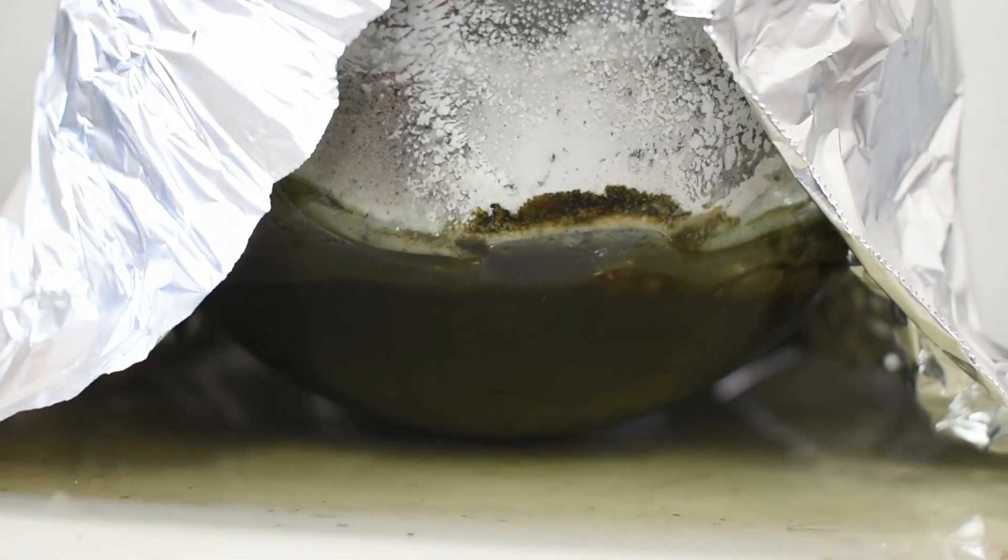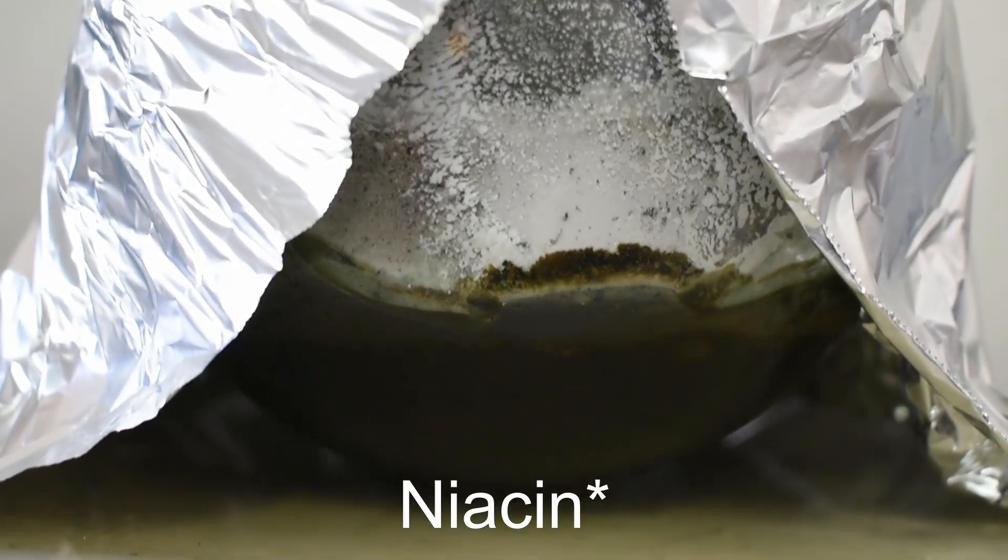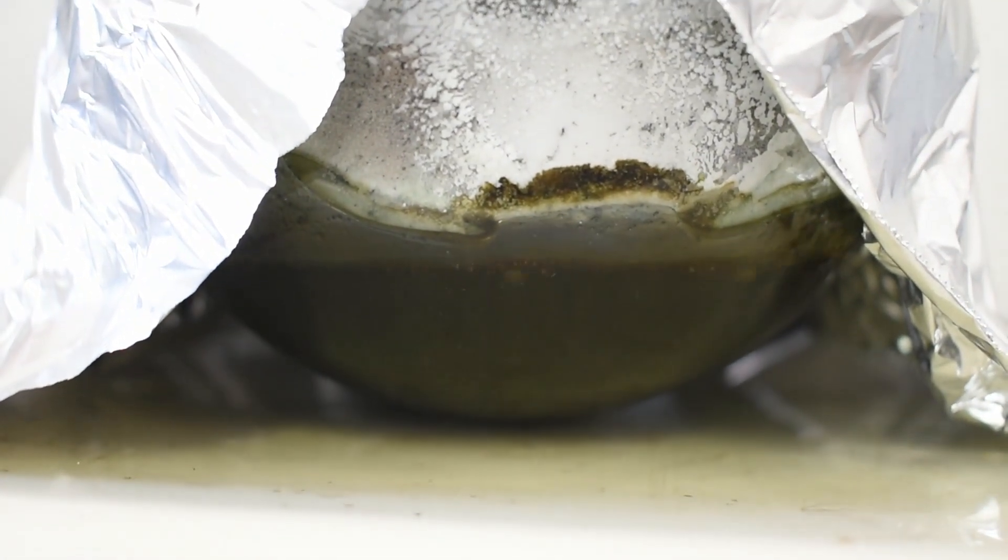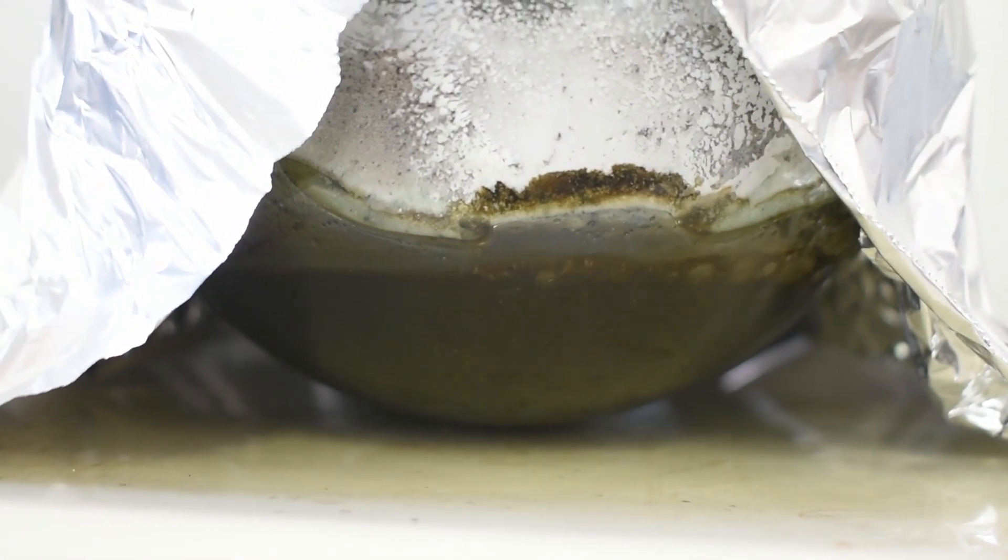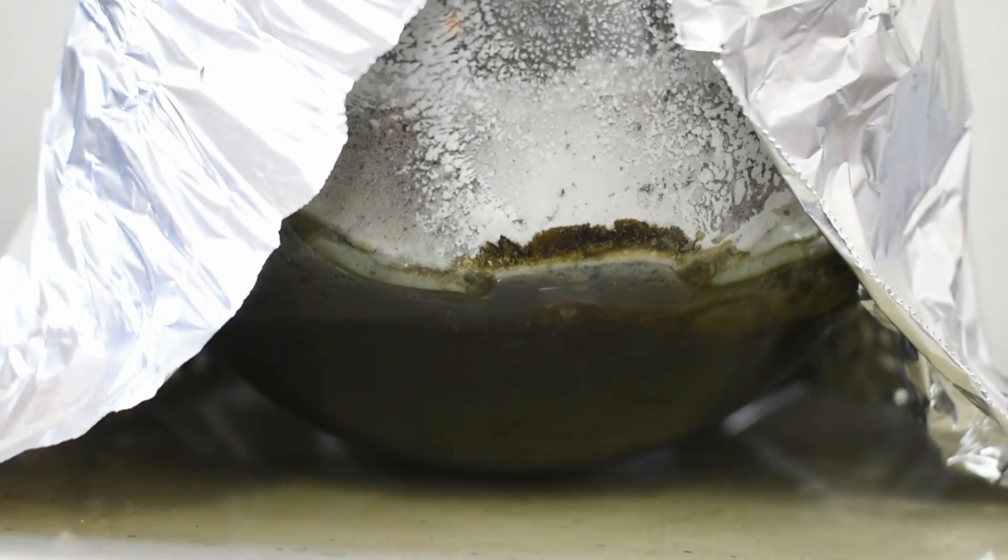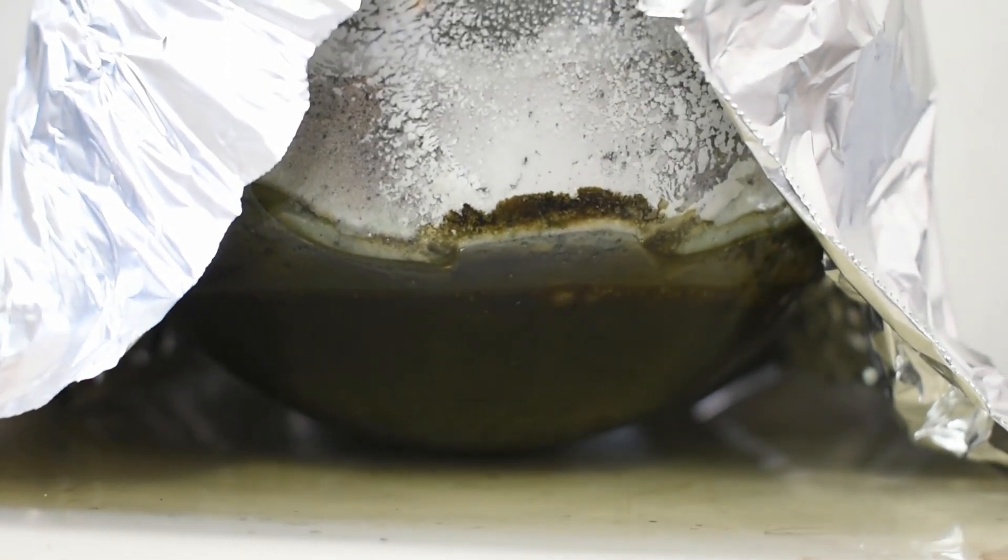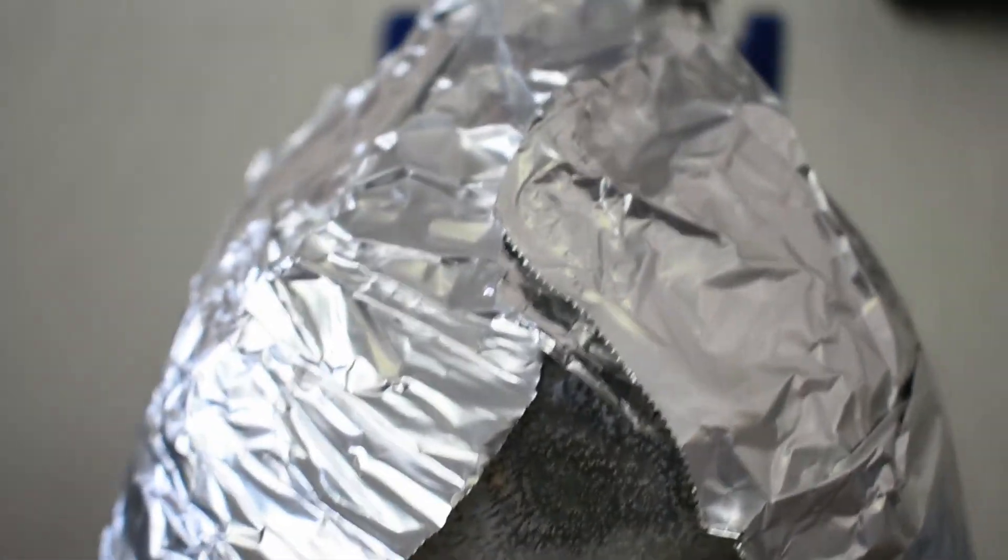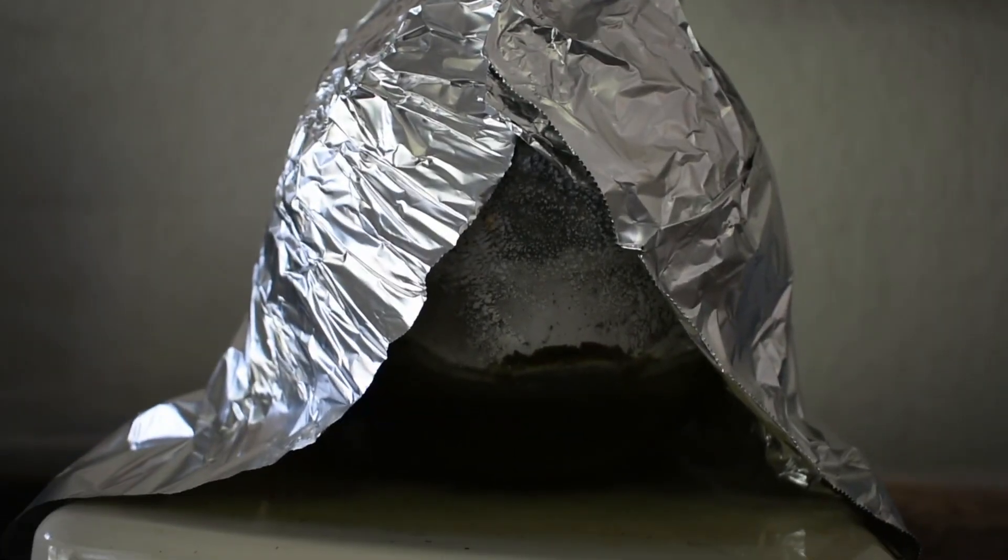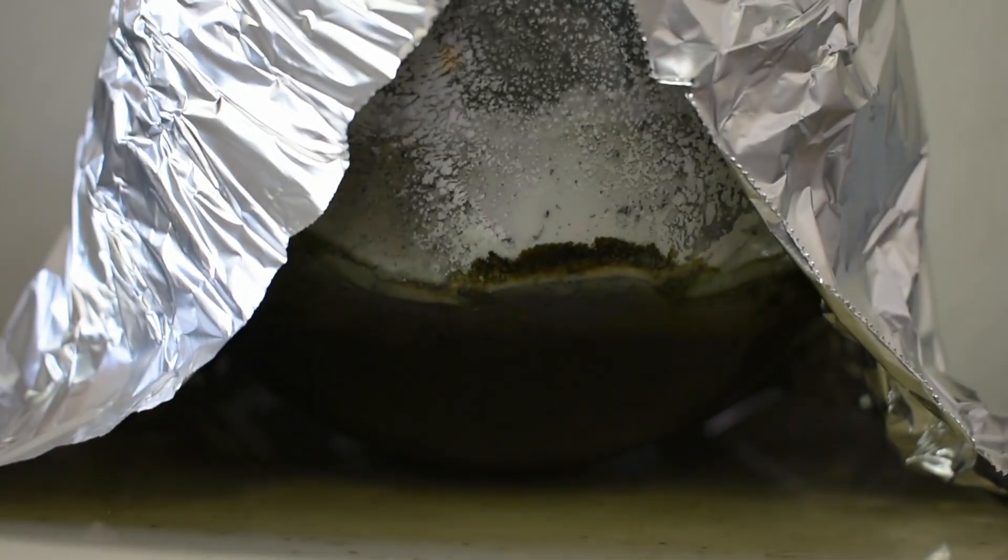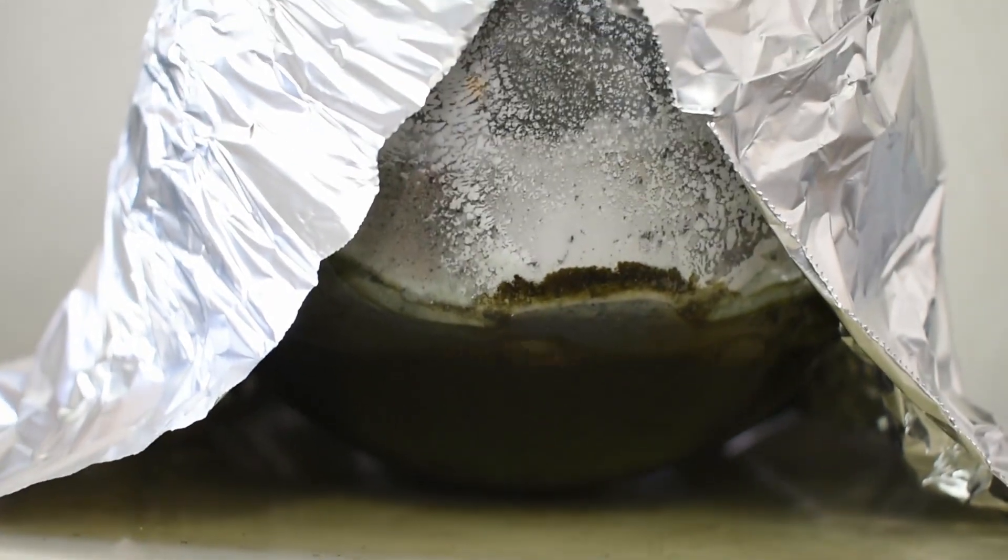I missed it, but that big chunk of pyridine that was on top of the liquid just fell in. Now we've got a real good amount of pyridine being produced. I also insulated with some more foil. Gotta keep the heat in. The temperature is rising. It's almost to 100 Celsius now.